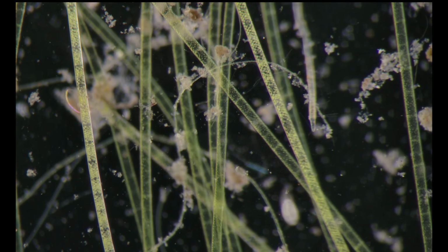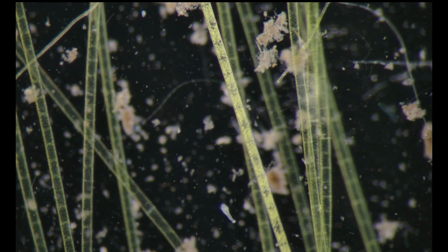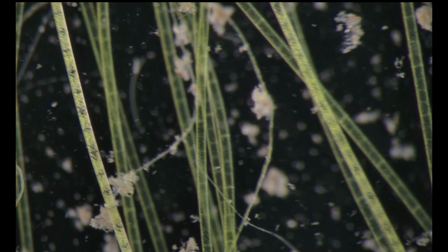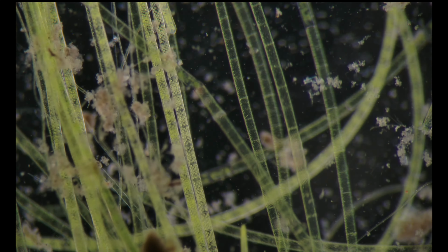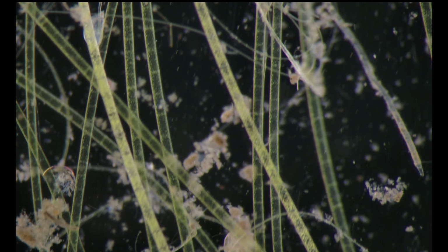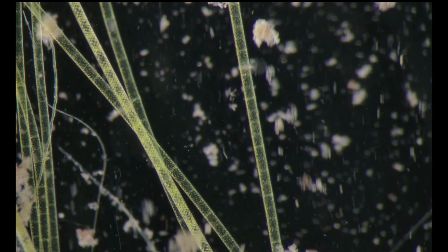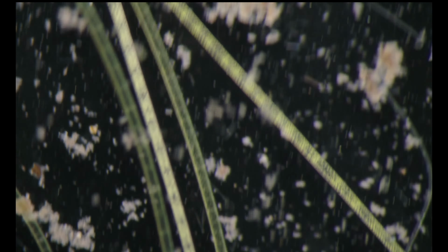Okay, let's look a bit at those Spirogyra filaments. Stentor. If I'm thinking about my microscopy time, I think 70% is done on the stereo microscope, around 20% on the inverted microscope, and only 10% on the upright microscope.